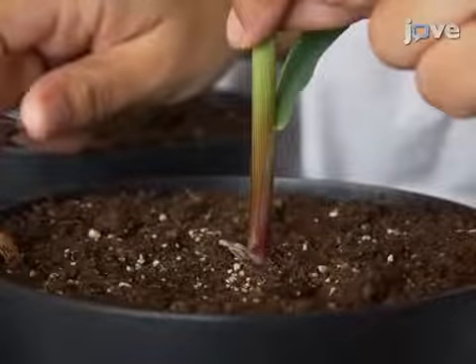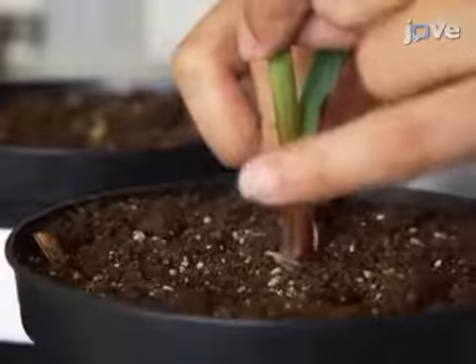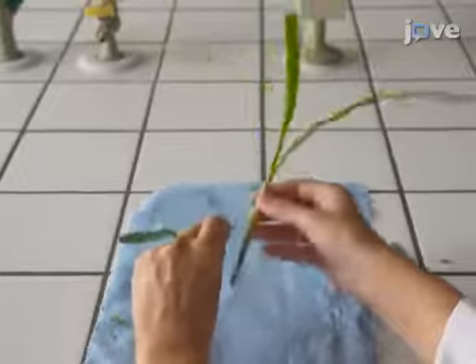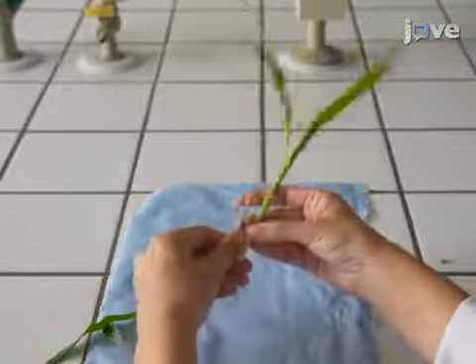At the developmental stage of interest, cut the above-ground part of the plant from at least 5 representative plants as close to the roots as possible to keep the meristematic region intact. Then, starting from the outer leaves, gently unroll all of the leaves up to the leaf of interest one by one, removing a few extra millimeters from the base.